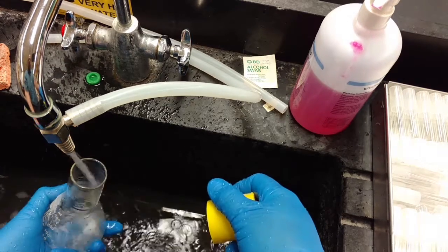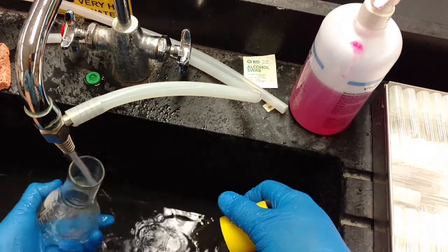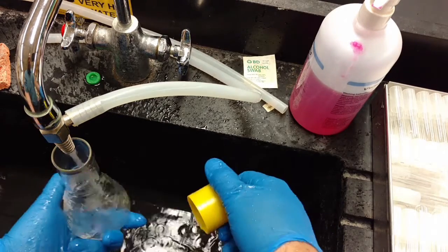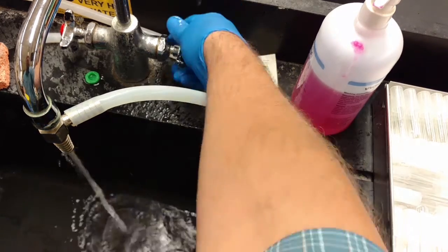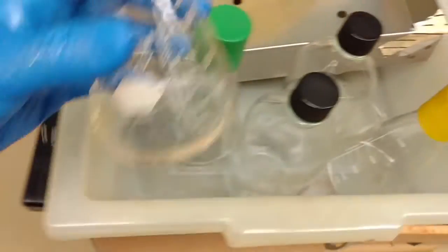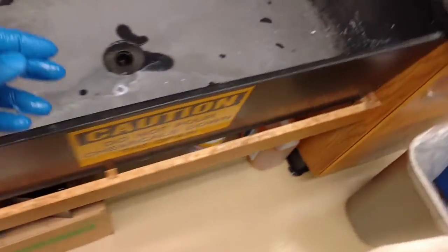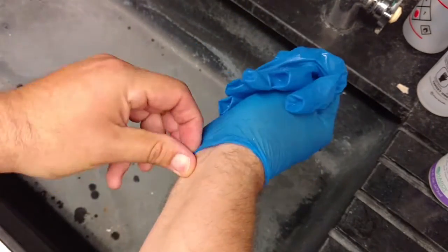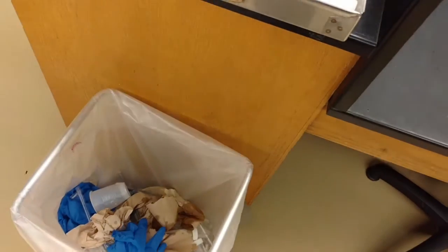Get all the soap and water out — if it still smells, it isn't clean. Then it goes over by the big sink to be cleaned further. Your gloves are now contaminated and you should change them — they've got crud all over them.